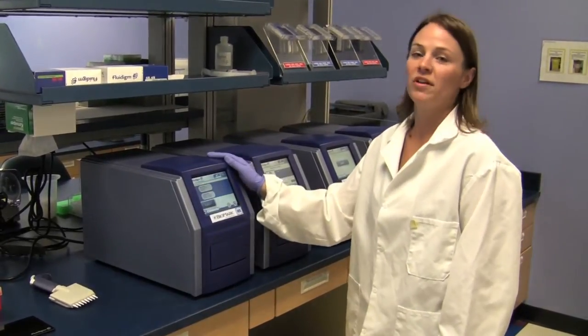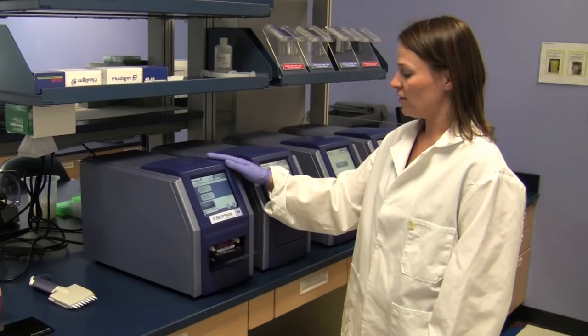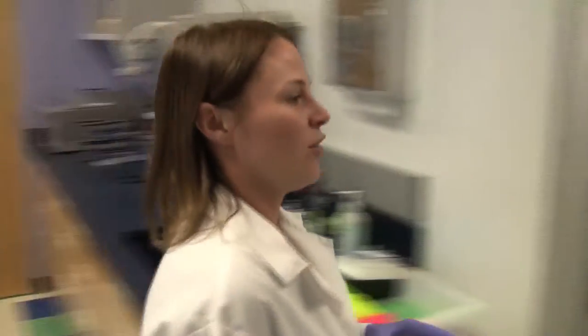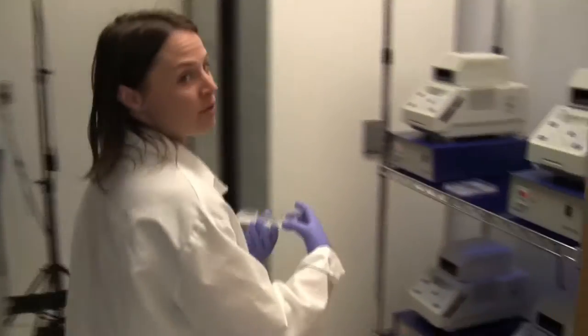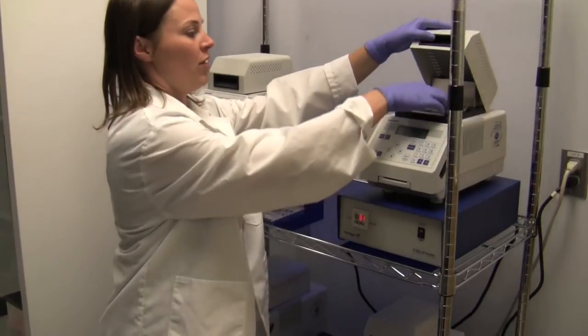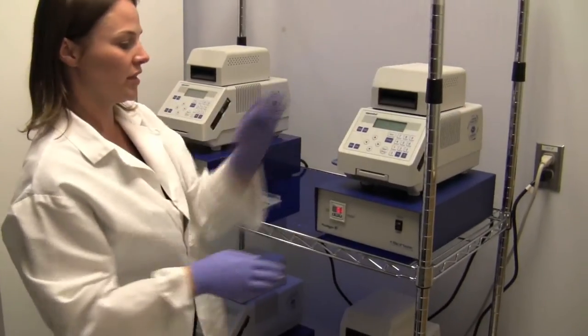So once the chip run is finished, you eject the chip. I'm going to take it over to what we call our stand-alone thermocycler. I'll just place the chip on the thermocycler and close the lid.